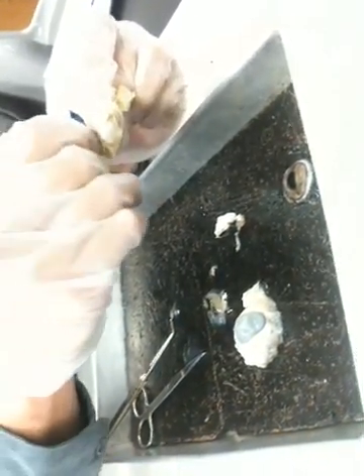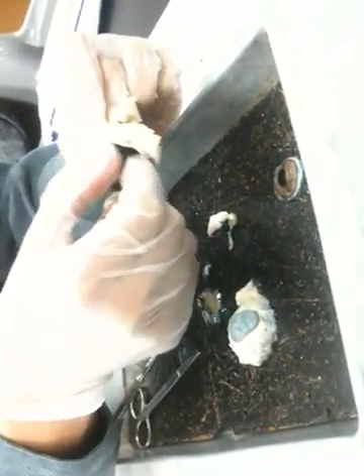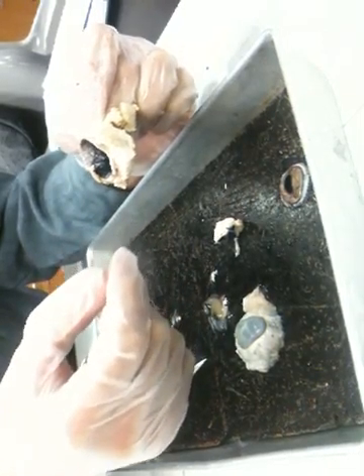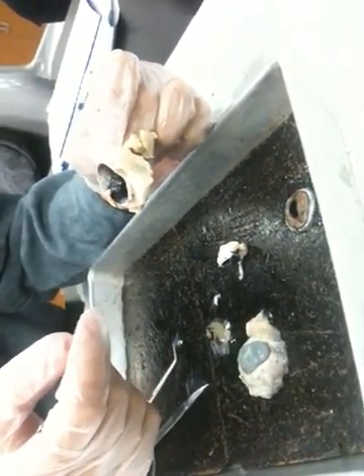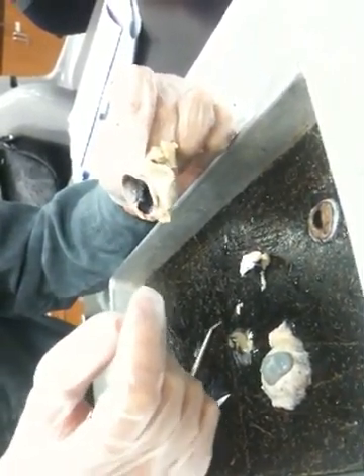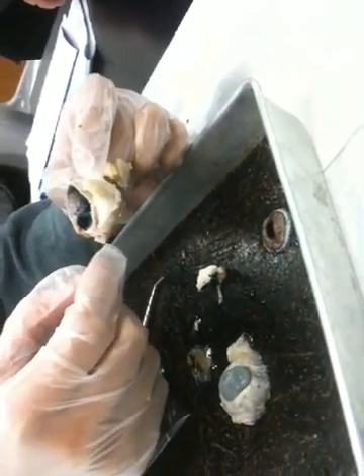Okay. That's the eye, guys. It's pretty simple. It's not very hard. Where's the... Malleus lutea? The something lutea? Macula lutea. Macula. Will you be able to see that?